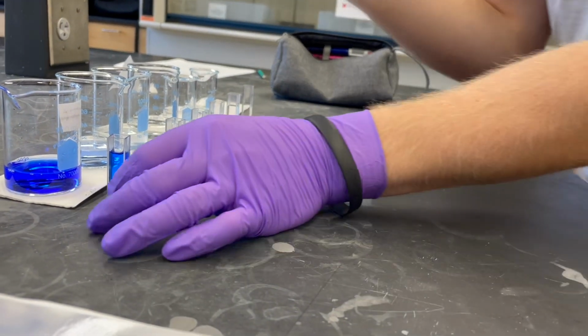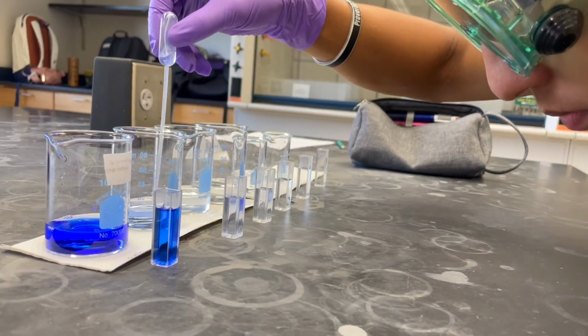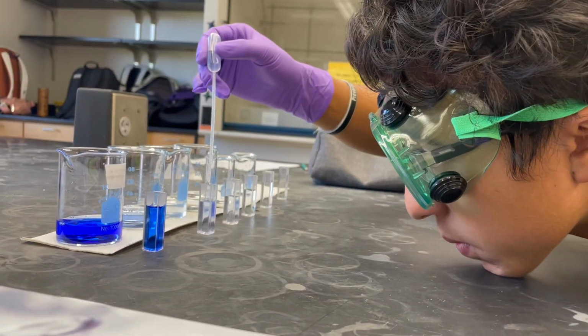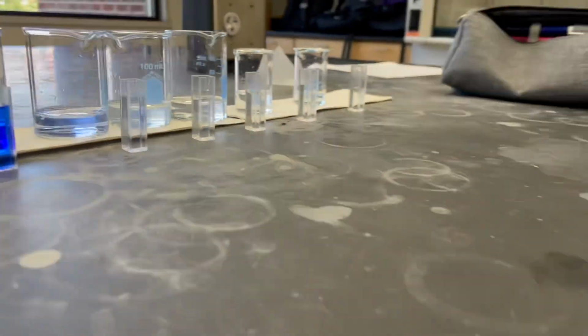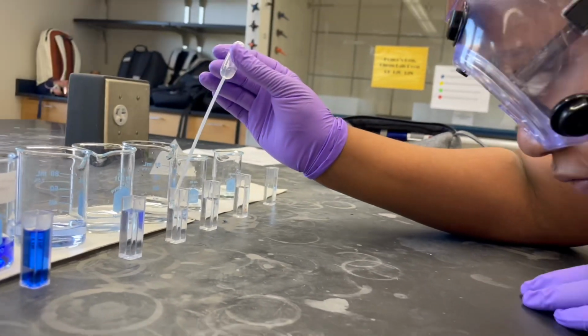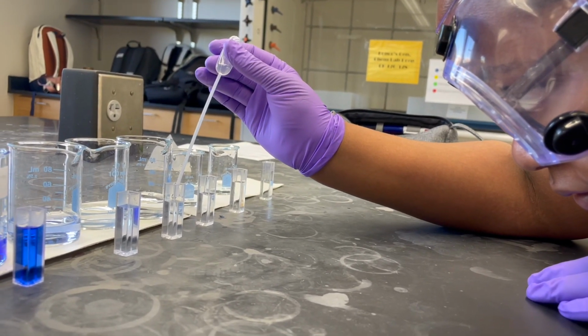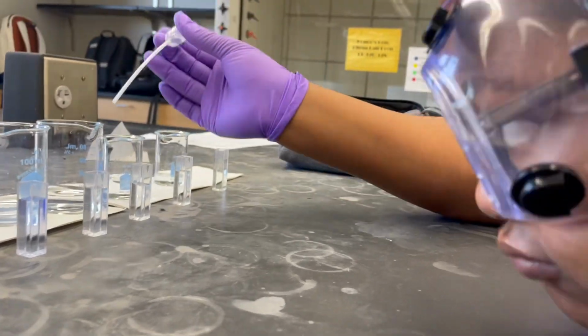However, you need to remember that stock solution should be poured in a beaker prior to use, as it is incorrect lab procedure to take contents directly out of the stock solution bottle or container. Our next task involved making a series of dilutions from the stock solution. If you question your ability to perform a series of dilutions, go back and watch our lab video on dilutions.